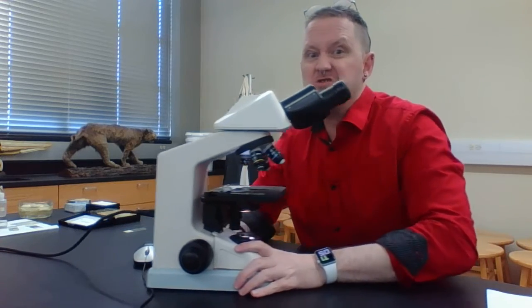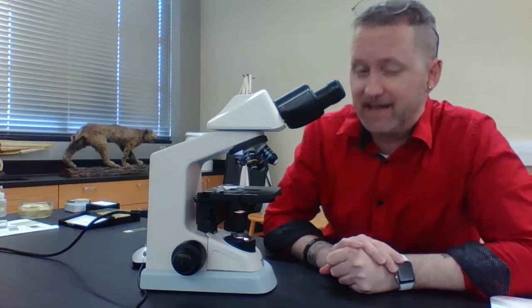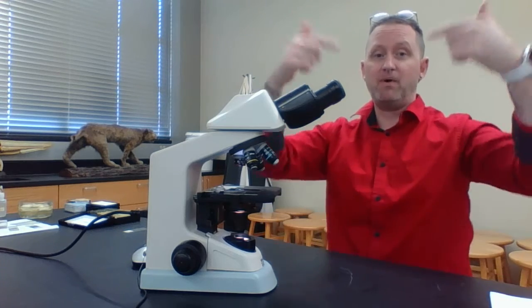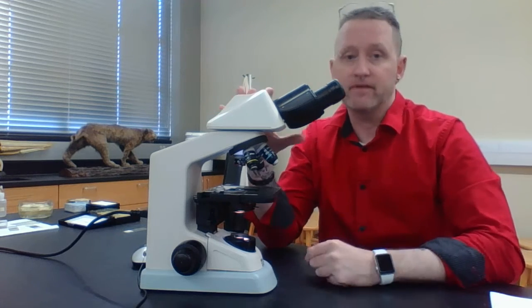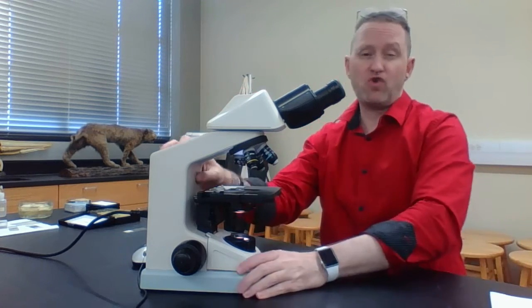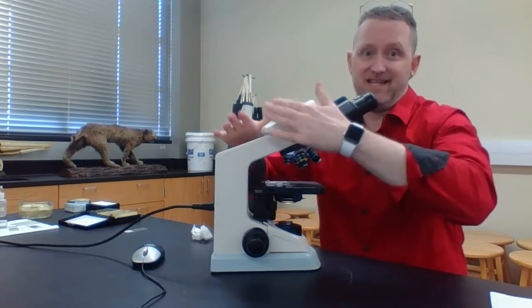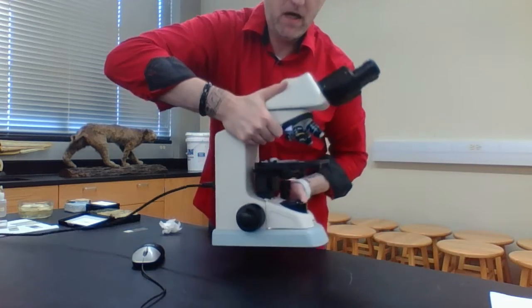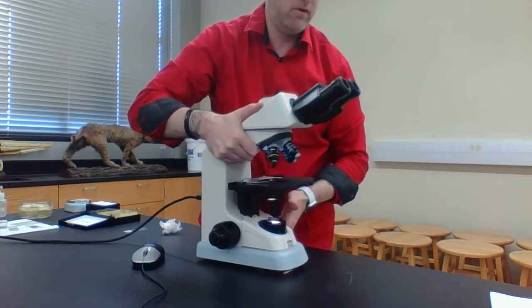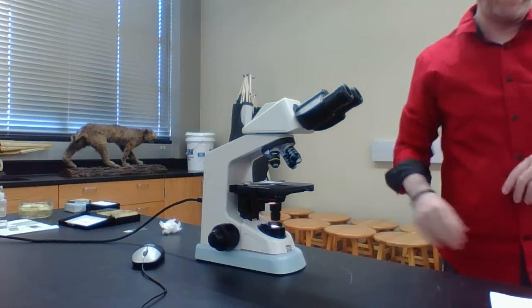Once you start to scoot that microscope, it'll vibrate. And if that prism comes loose, I can actually tell by looking at it, because some parts will be in focus and other parts will be out of focus. And again, what you've done is the microscope needs to be repaired. So try not to scoot the microscope. Once you put your microscope in a certain position, let it sit. If you do have to move it, pick it up and then move it instead of scooting it. So that's basically how we use the microscope.